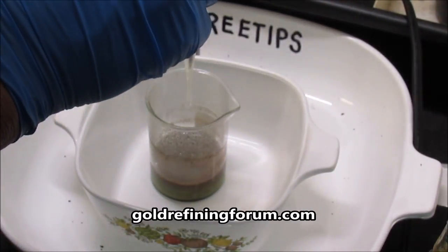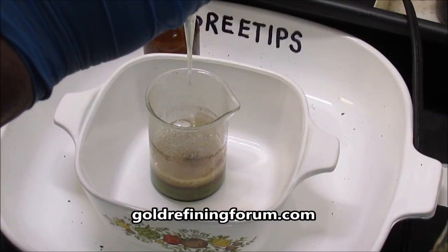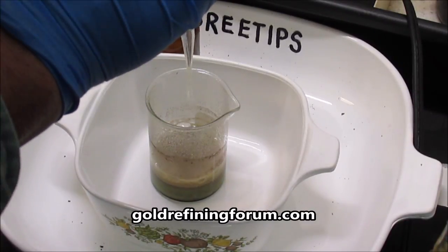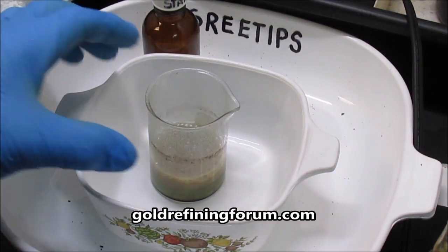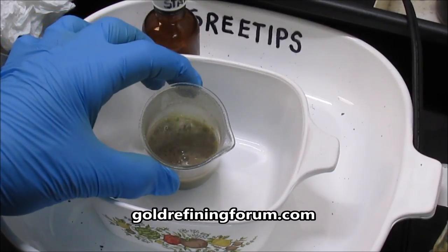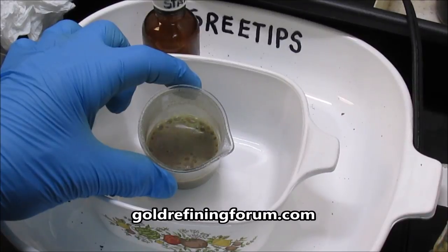Here I'm adding another shot of 12% hydrogen peroxide. It produces a very vigorous reaction. Not quite sure if this is the right way to go here. I checked the gold refining forum and on there this stuff has been banned from discussion because it's just too dangerous. So I don't know if this is the correct way to go or not.